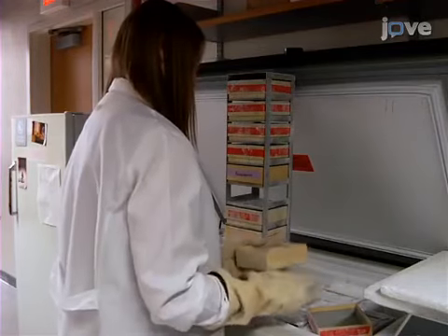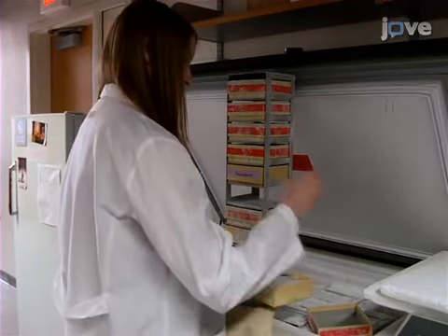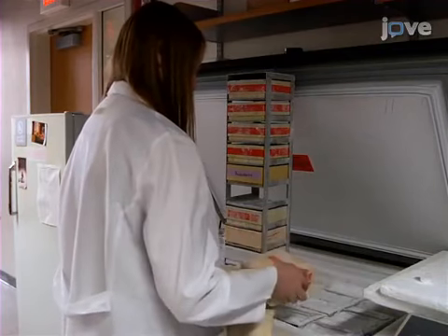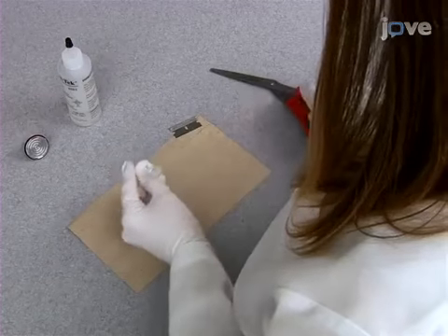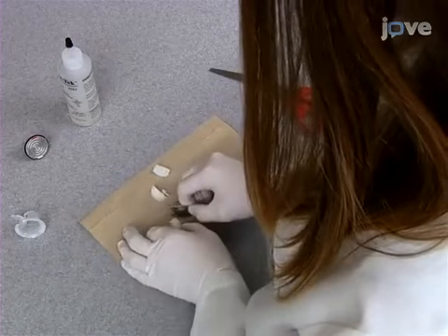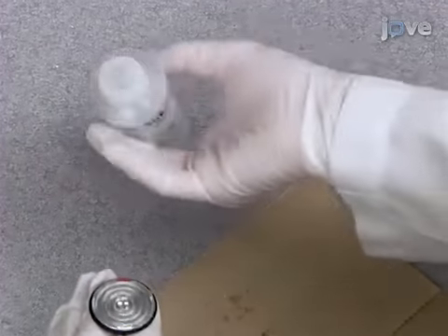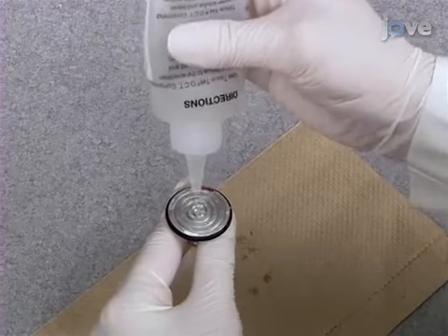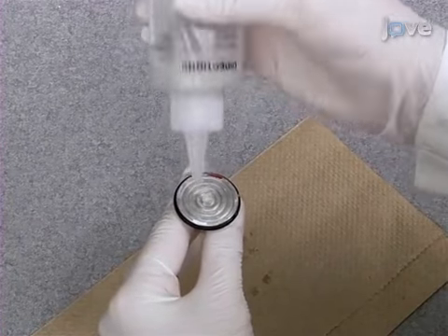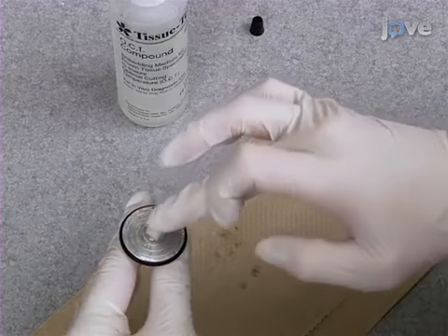First, remove previously prepared plant tissue samples from the minus 80 degrees Celsius freezer. Then, cut away the plastic cryostat cup and trim away the excess gelatin. Mount the embedded tissue to a cryostat chuck with a dime-sized amount of optimal cutting temperature, or OCT, media, while not letting the OCT touch the tissue.